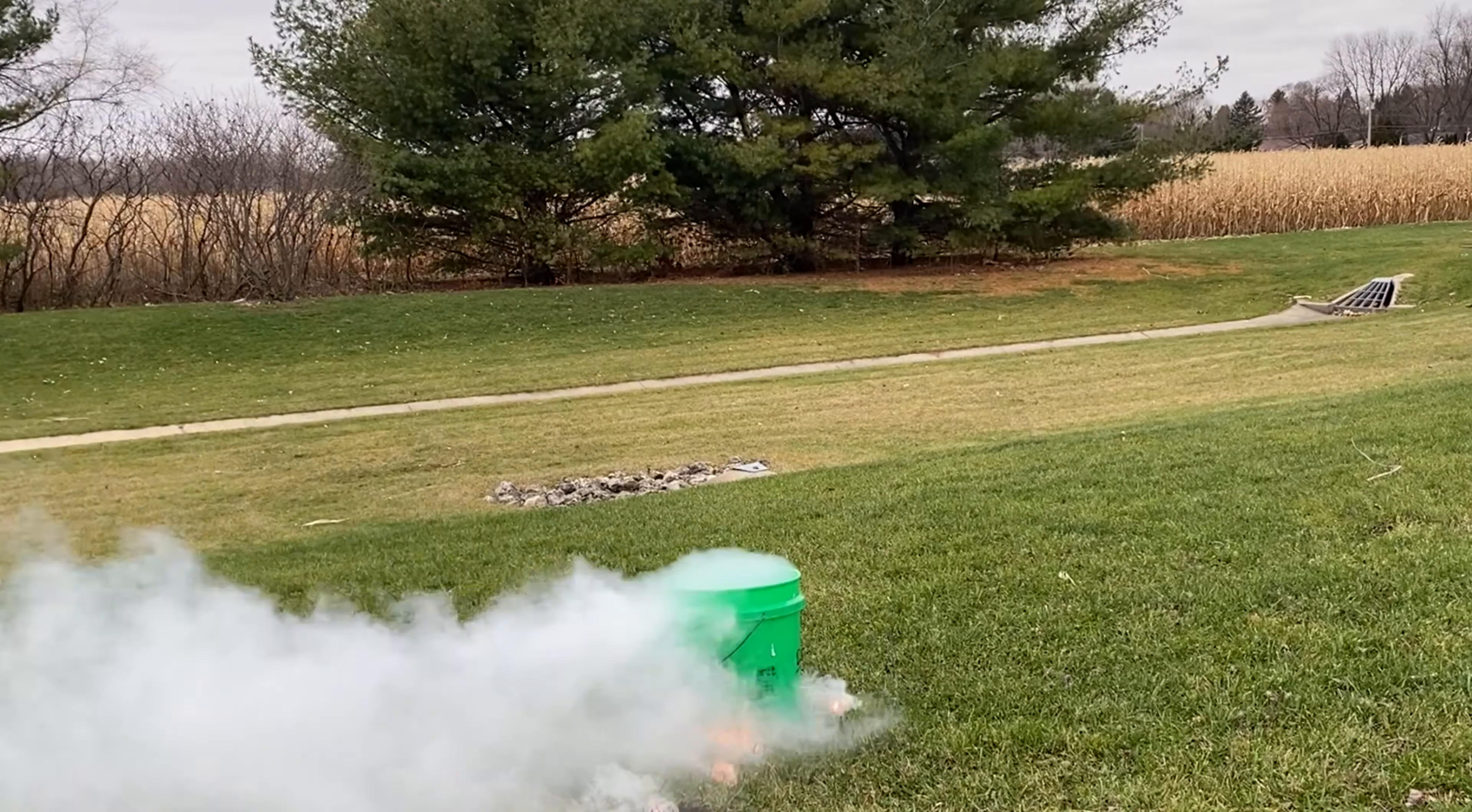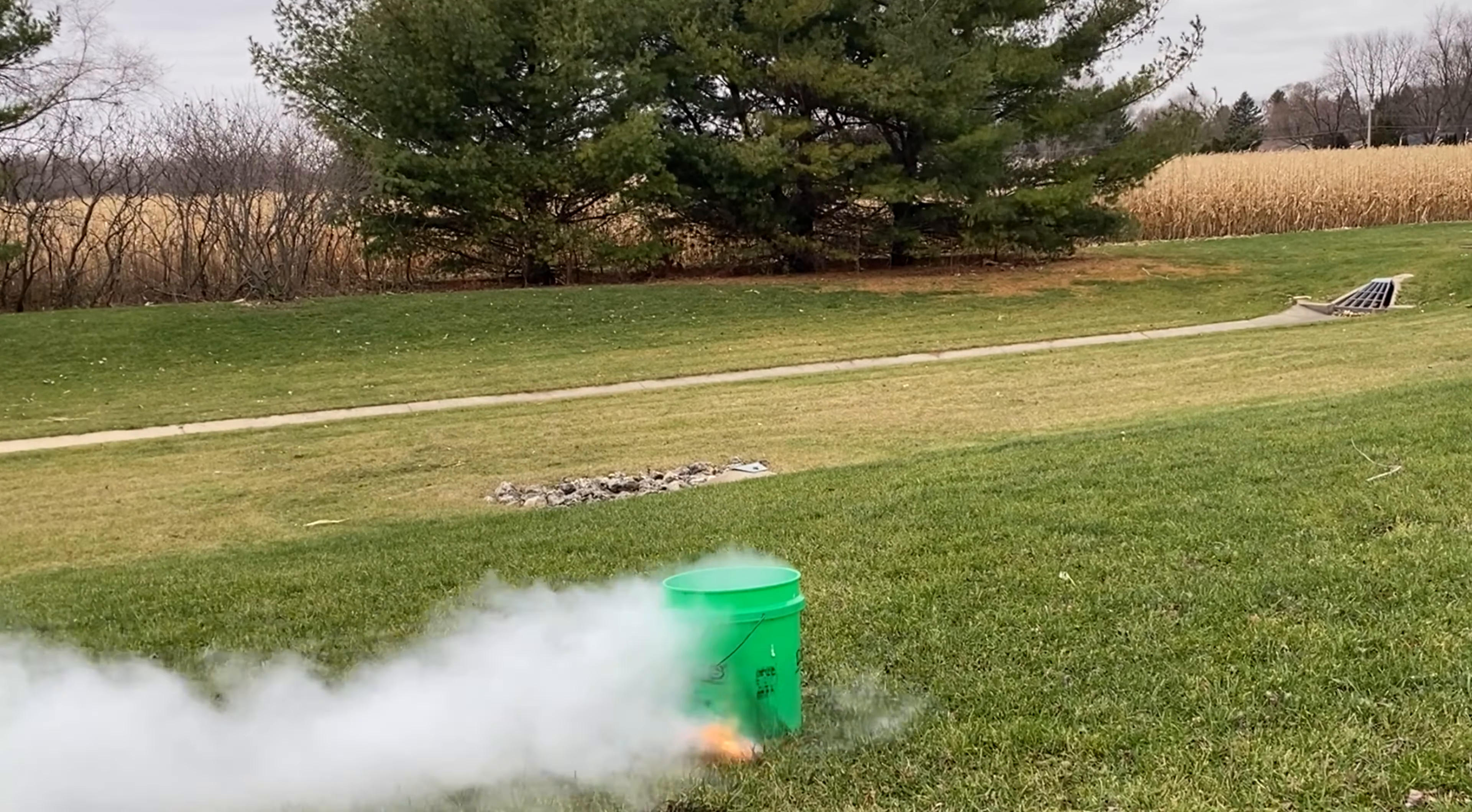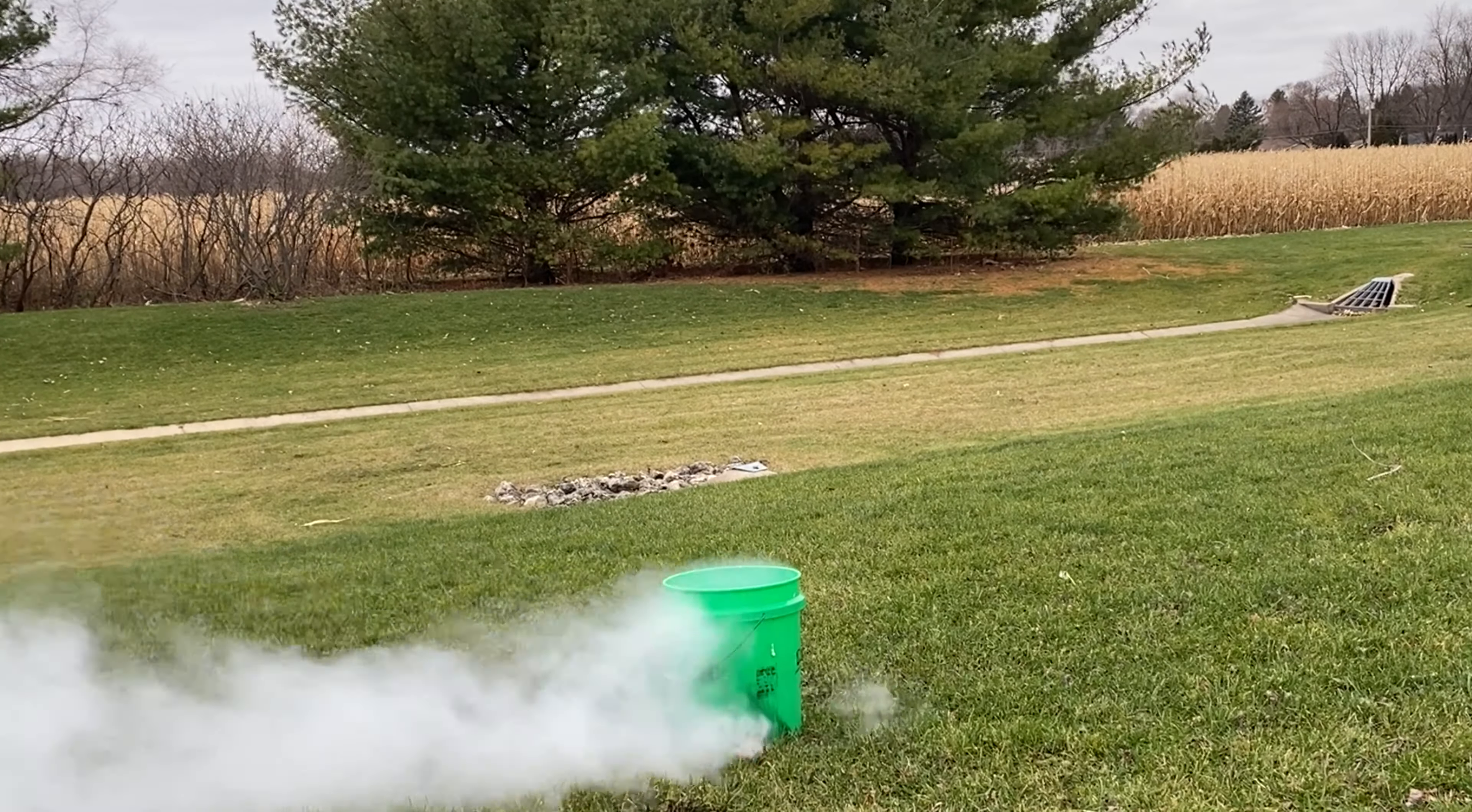Here we go. Hey guys, today I'd like to do a lab with you in which you are going to take some observations of the element sodium, which I have in this container here. Sodium can be found on your periodic table because it is an element. It's number 11, and it's in this first column, and all elements in this first column are referred to as alkali metals. So sodium is a metal, an alkali metal.